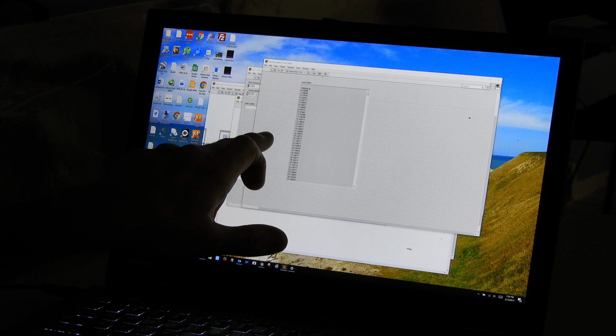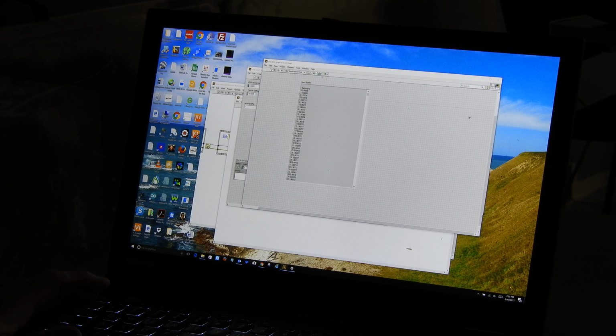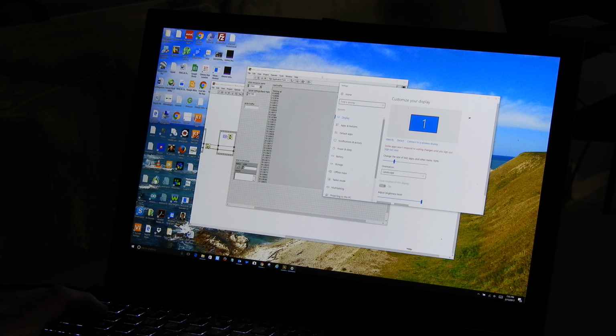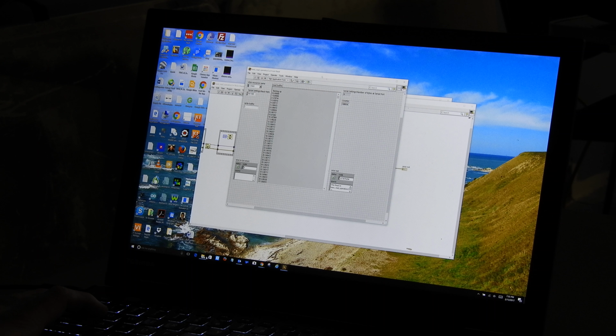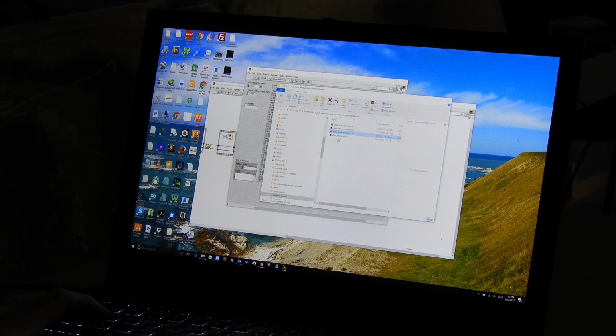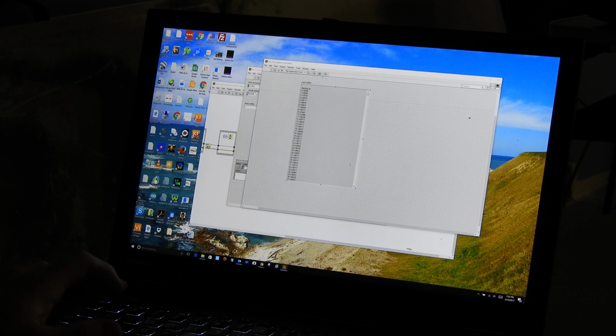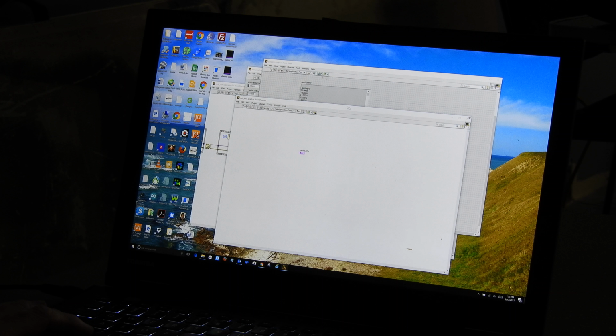That saved those values as the default values, so that now, were I to close this program and reopen it using, say, Windows Explorer, when I reopen it, it's going to open with those values in the control. Okay, so now I have a copy of values. Now let's go ahead and massage them into a graph. And the way I'm going to do that is, let's go over here and take a look at the control.